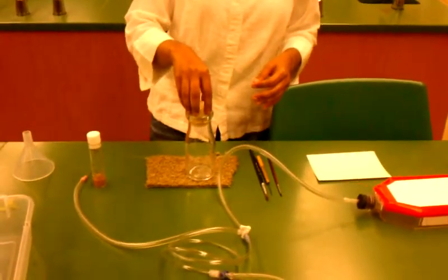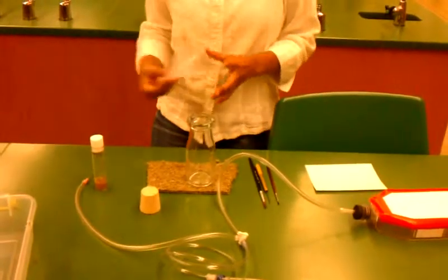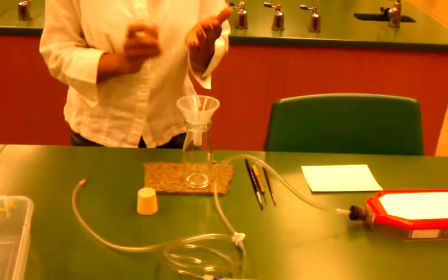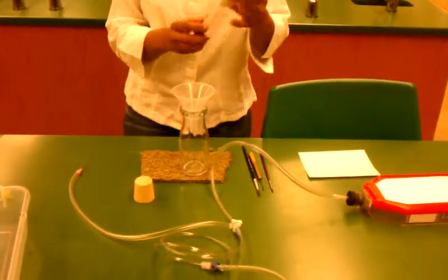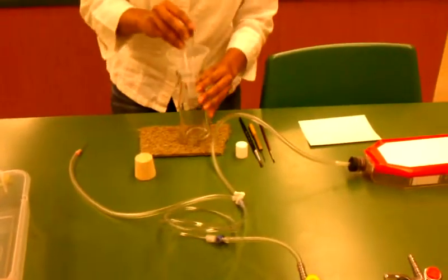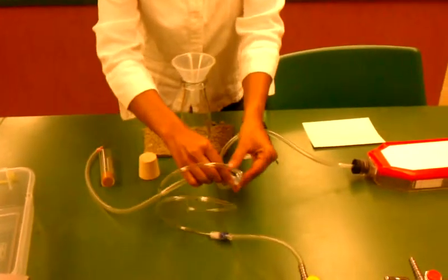On how to transfer the flies. Put a funnel into the bottle, take the vial with the flies and shake them down, then quickly invert them over the funnel and tap them so the flies go to the bottom of the bottle.